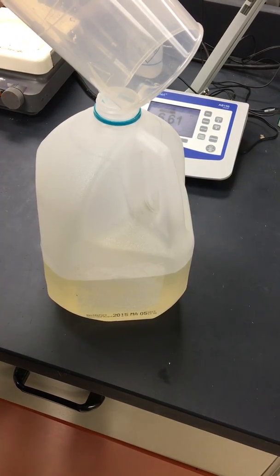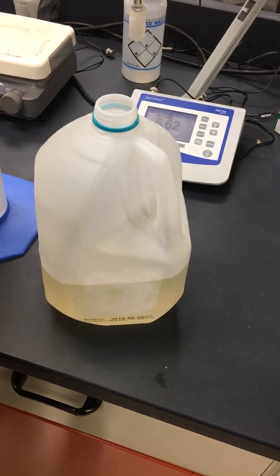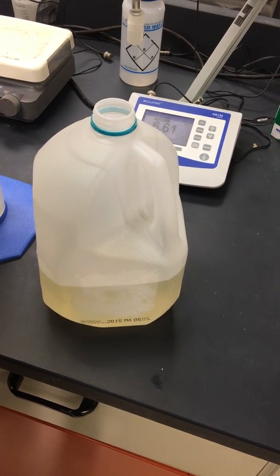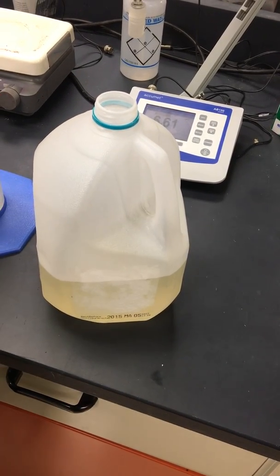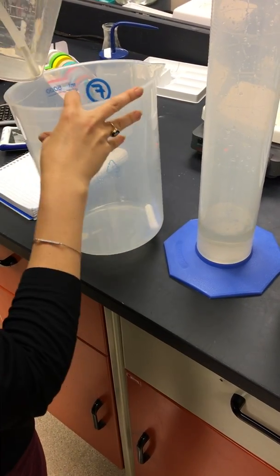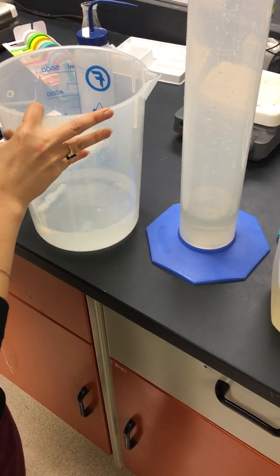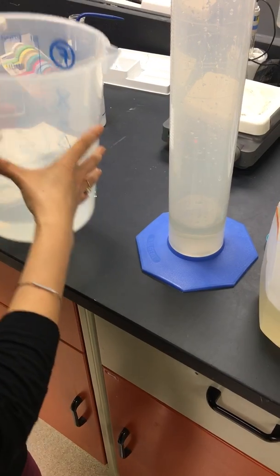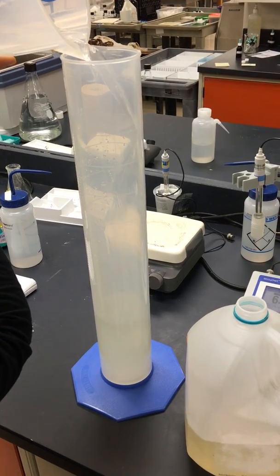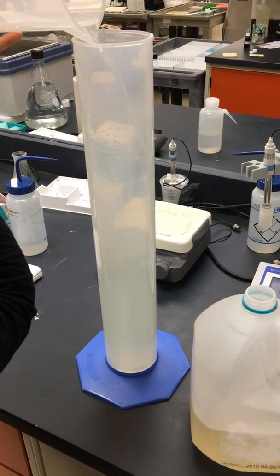Get all of it in there, and now we're going to add the rest. I've got some water here so I'm just going to pour it in here to get as much of the sugar out as possible. And now we're going to bring the whole thing up to 2000, because we want four liters — we've already got 2000 and we want another 2000.